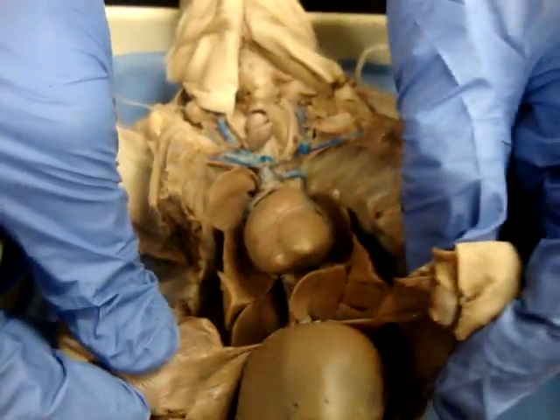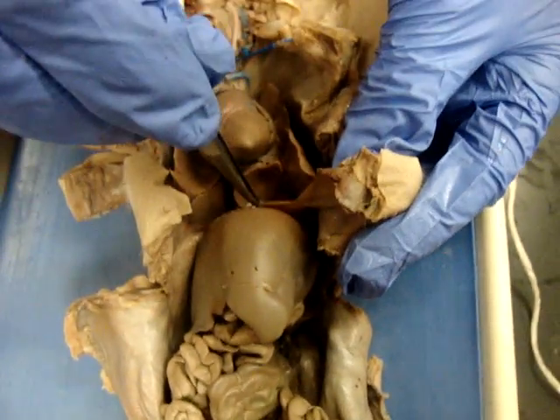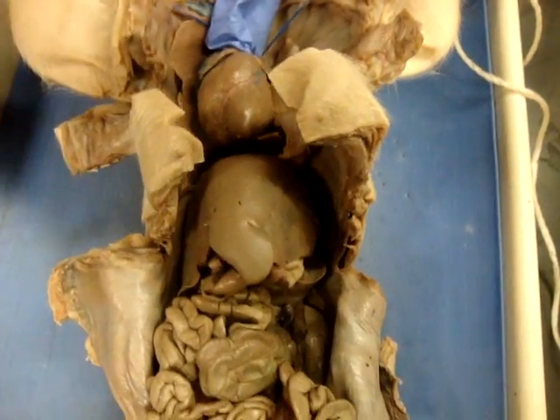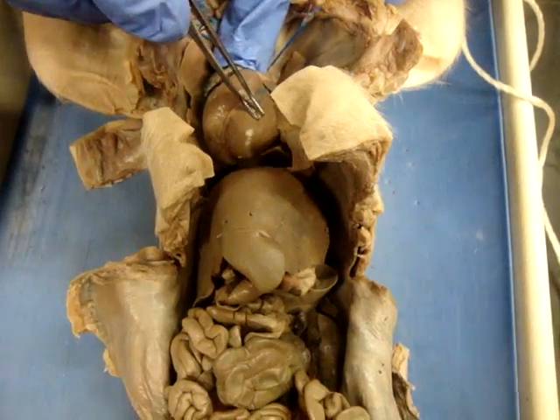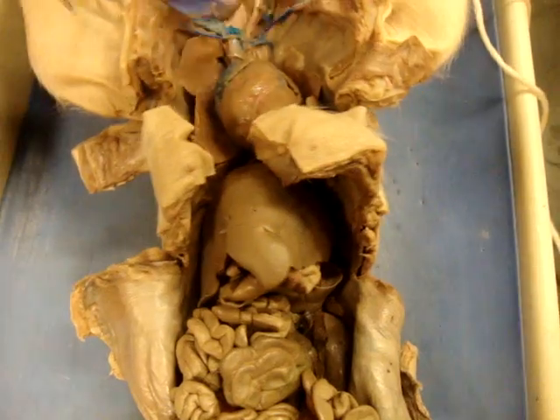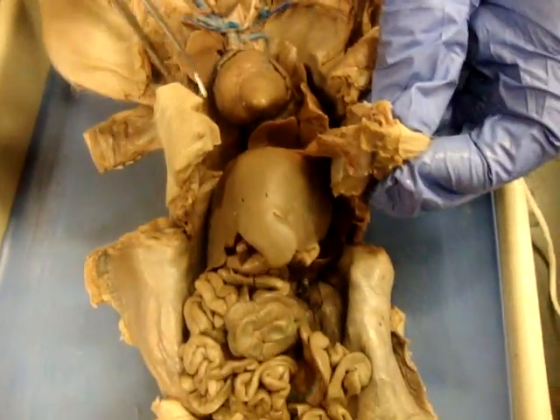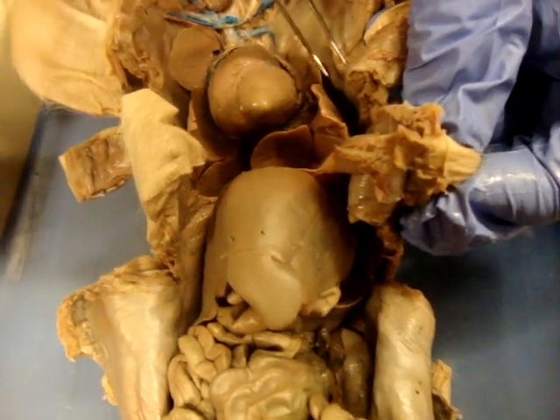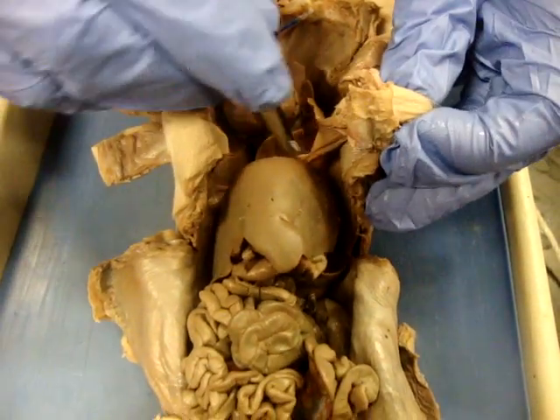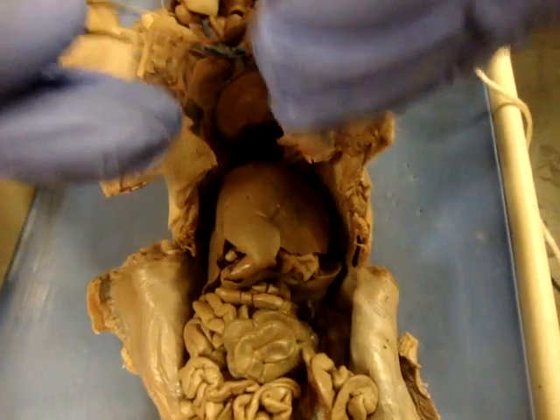Then we go up into our thoracic cavity. Your thoracic cavity is everything above the diaphragm. What we're looking at is going to be our heart — you're going to see the right side and the left side of the heart: right ventricle, left ventricle, right atrium, left atrium. Those are our major parts of the heart. We've got a right lung and a left lung. And then also the diaphragm, which is this really thin muscle that separates your thoracic cavity from your abdominal cavity.